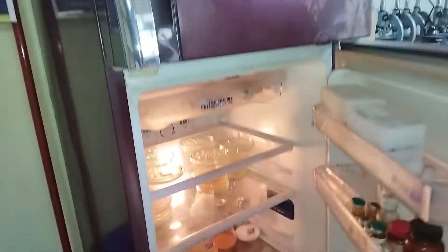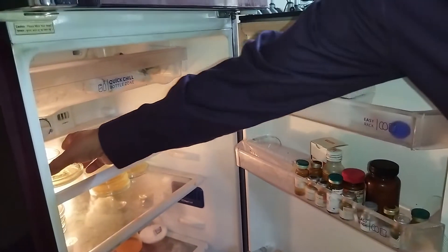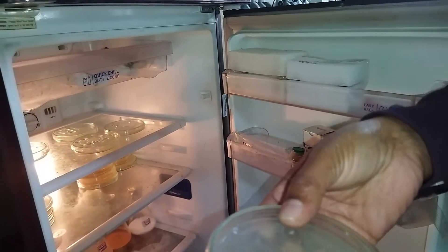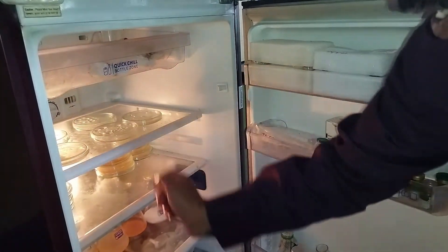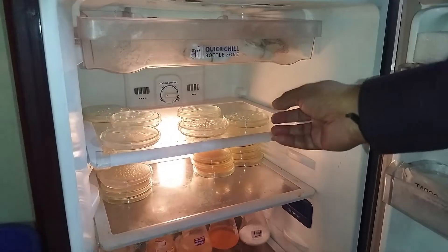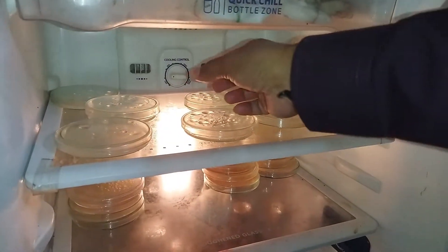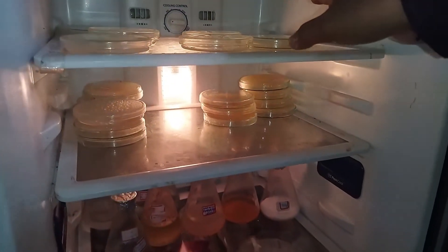You can see the cultures which are maintained in the refrigerator — this is a bacterial culture. Similarly, we have many other cultures maintained in the refrigerator, and these cultures are used later for research purposes. There are a number of bacterial cultures which are maintained in the refrigerator.